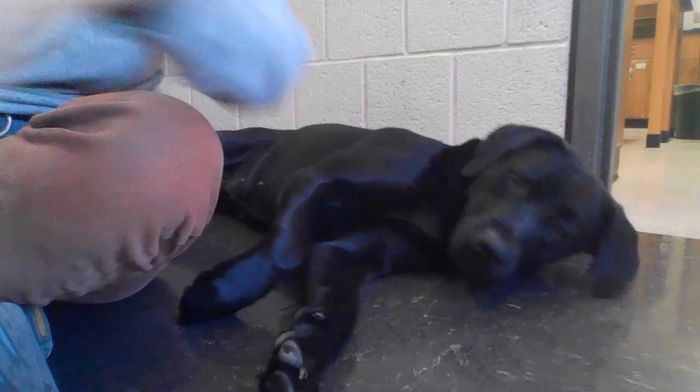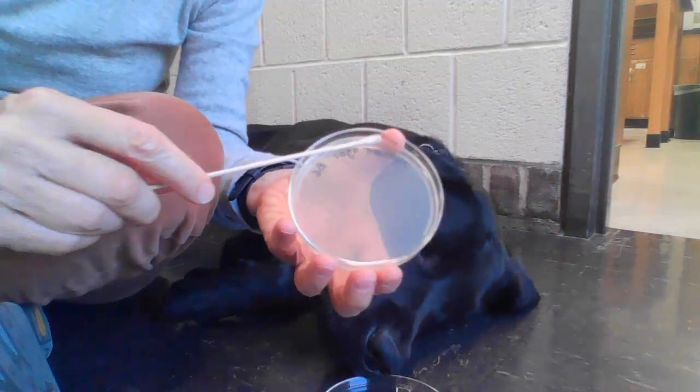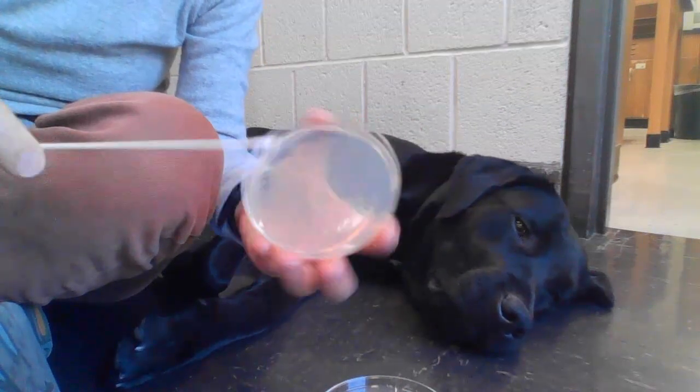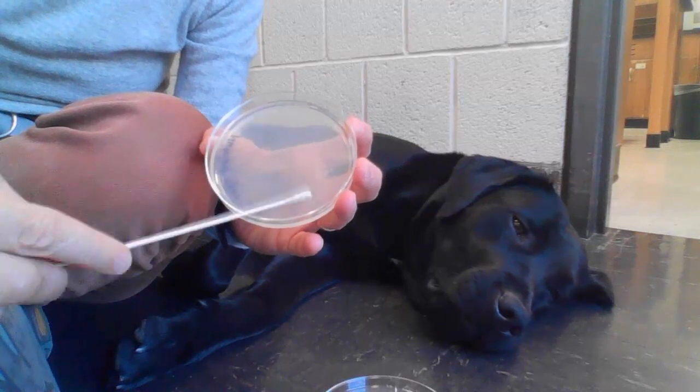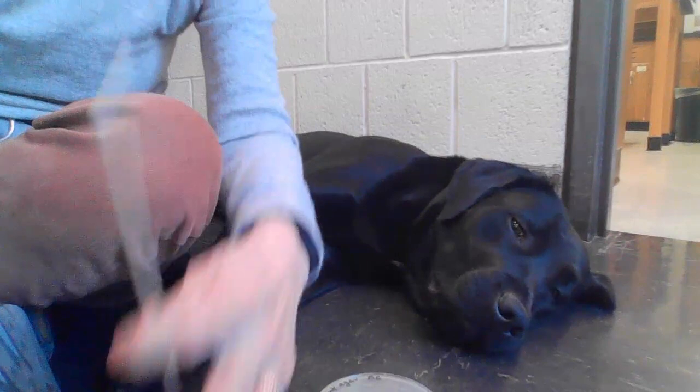Thank you, Jeanette. And I'm just going to take a plate like I did last time, and I'm going to swab. Don't put your nose in there. That'll make it not sterile. And swab again. So what do you think? Do you think the bottom of Jeanette's foot is going to look more like the bottom of my shoe, dust, or my skin? Wait, look at the results and you'll see.